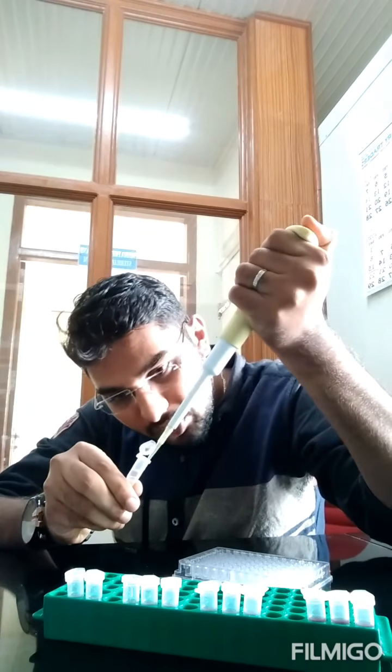So how much proline is present quantitatively? We are going to quantify using the standard graph method. I have taken the microplate over here, and 200 microliter I am going to hold because this can hold only up to 300 or 350. So carefully I am going to pipette out only the upper layer. Don't touch the lower layer, just take some 200 microliter or so.